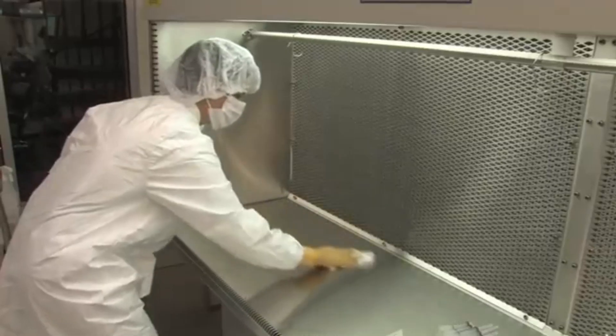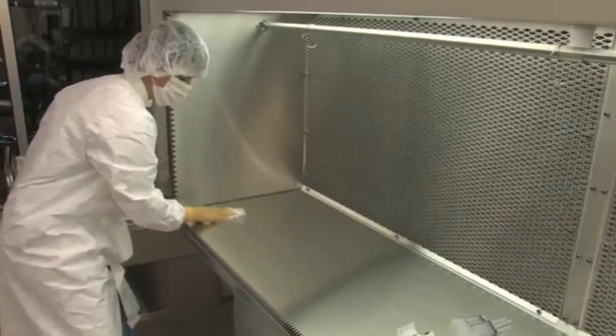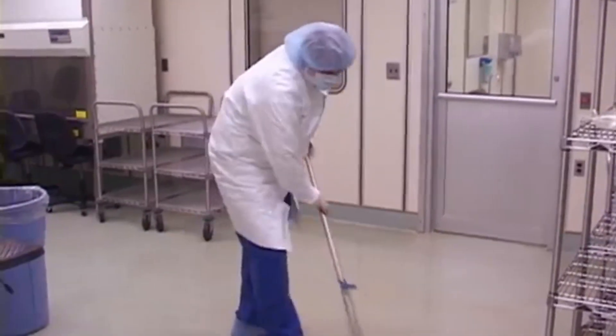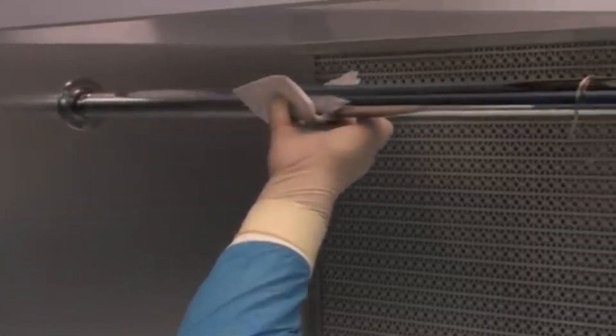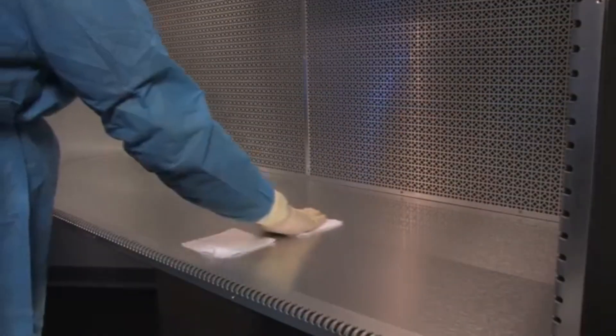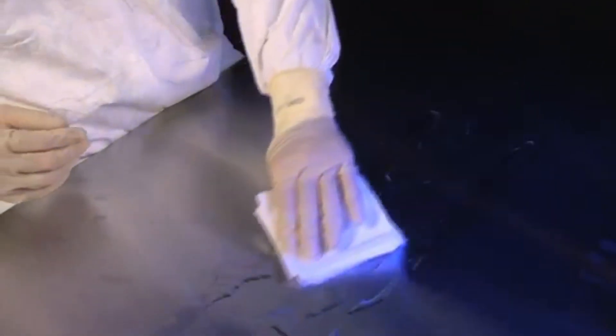Compounding sterile preparations requires a pristine work area. Compounding personnel must clean and disinfect primary engineering controls. Some facility cleaning may be done by trained housekeeping personnel, but compounding personnel must know how to clean and disinfect every surface of the sterile compounding area. Let's distinguish between cleaning and disinfecting: cleaning removes visible solids or soiling before disinfecting.